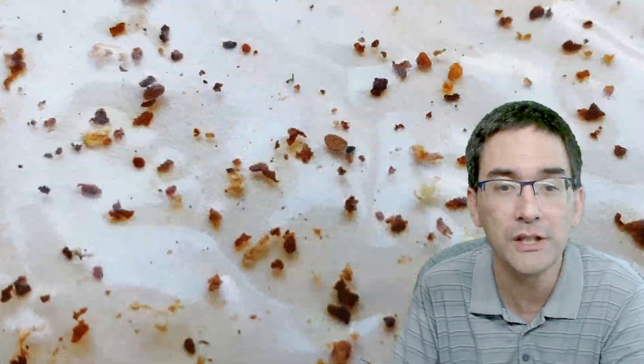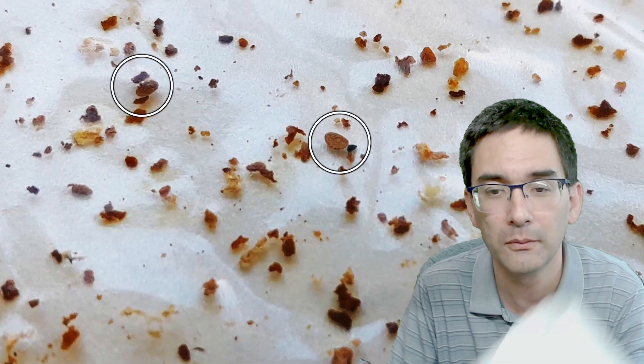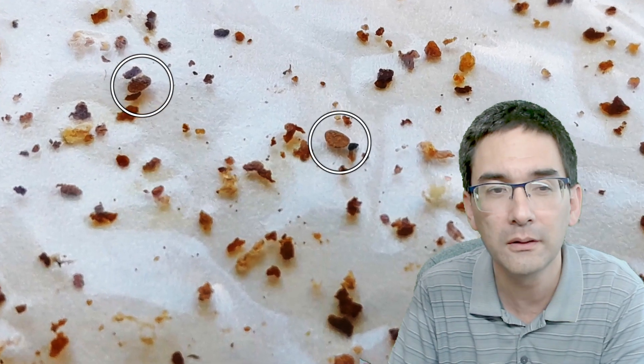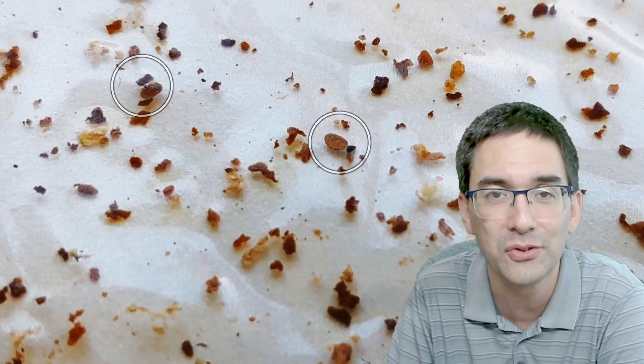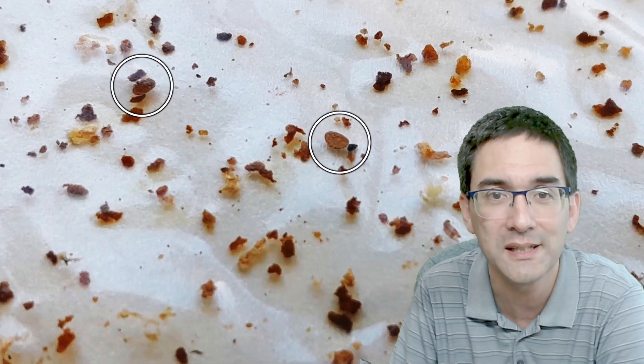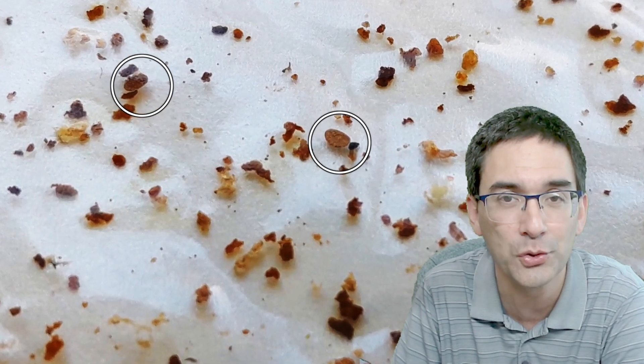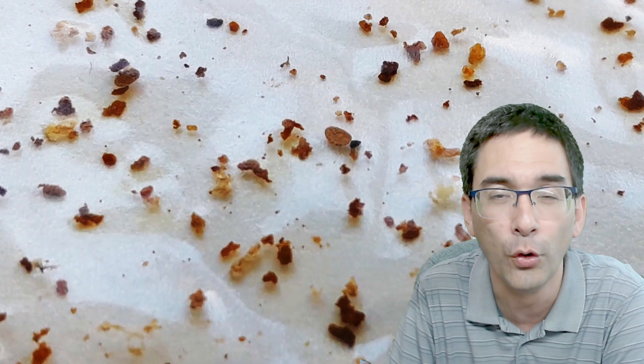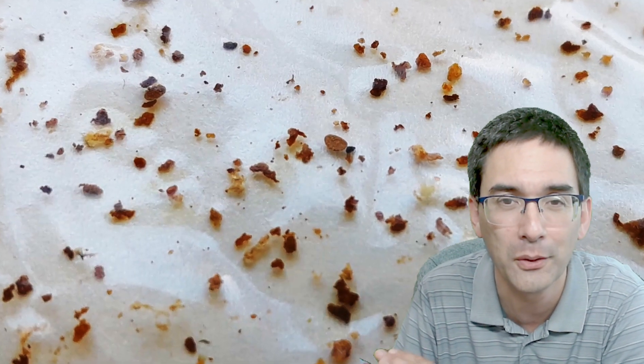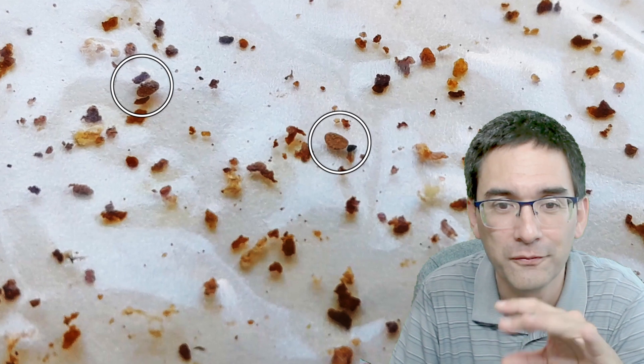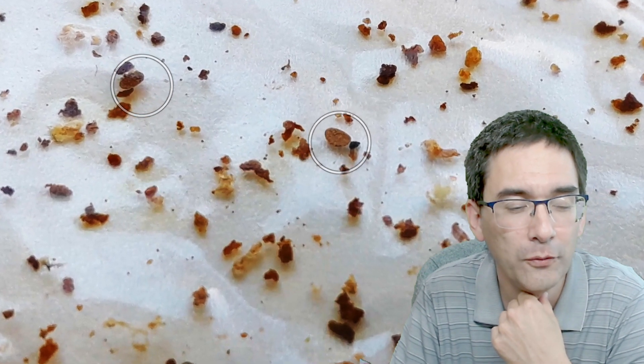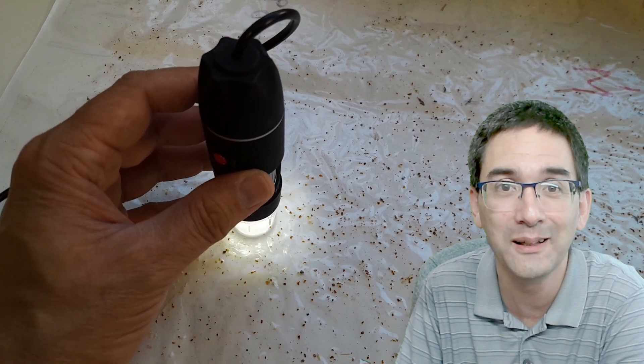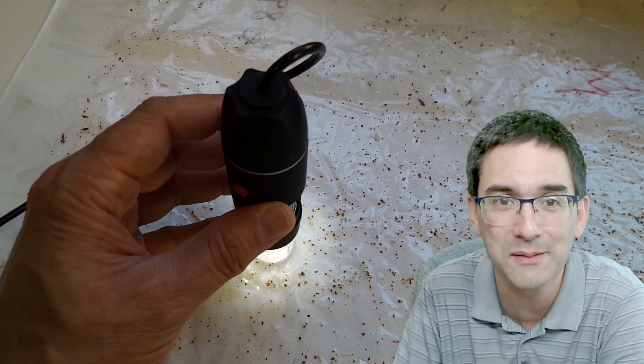I got this sheet, this roll of paper over here. Just by looking at it I was already able to identify a few mites. It's not even necessary to use a microscope - you can simply assess them by looking, because those mites look kind of oval and very regular in shape, while all the other parts that fell down inside the beehive look very irregular.